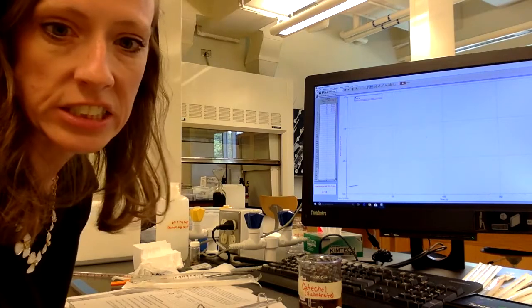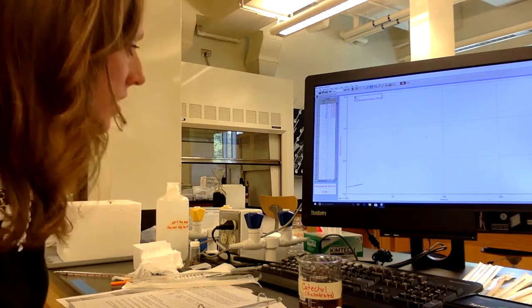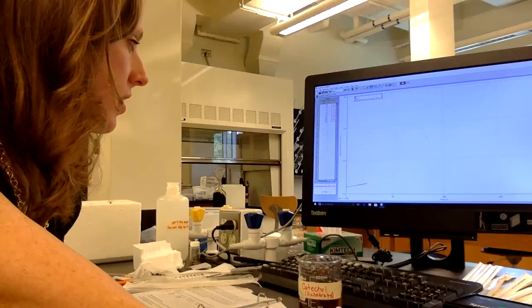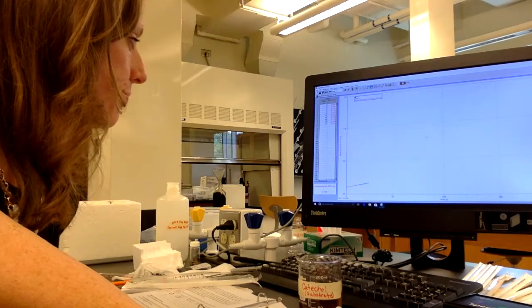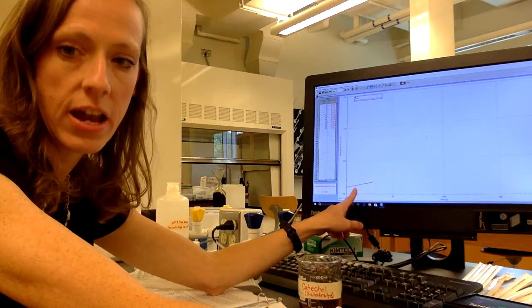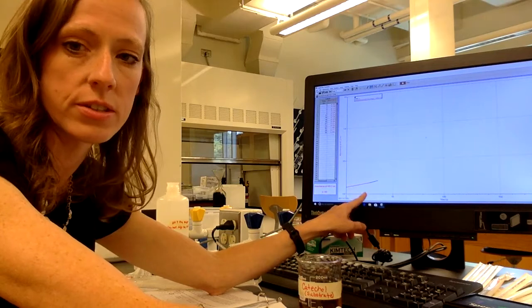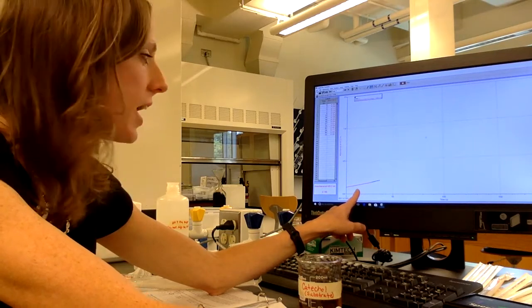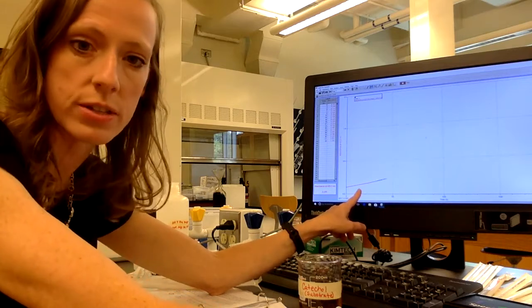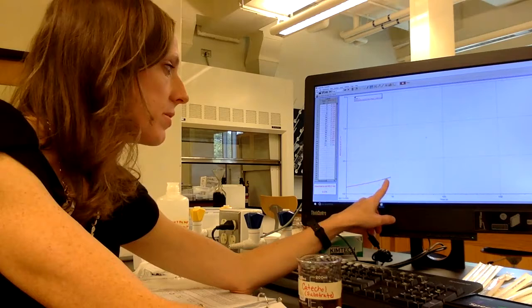I don't know, the line's not looking so good. I'm not sure I was all that quick because I was fumbling with the pipette a little bit. But you can see with a decreased enzyme concentration, the slope on this line has definitely decreased, which we would expect to happen. There's less enzyme available to use in that reaction. And so you would not expect the reaction to happen as readily.